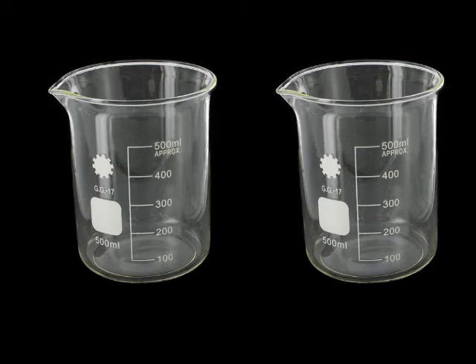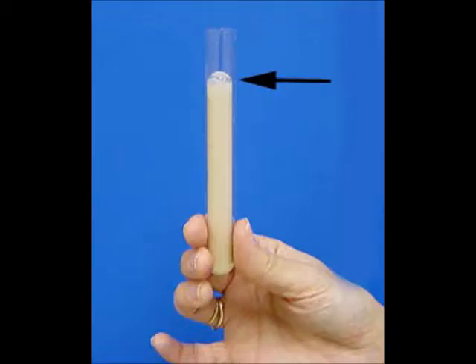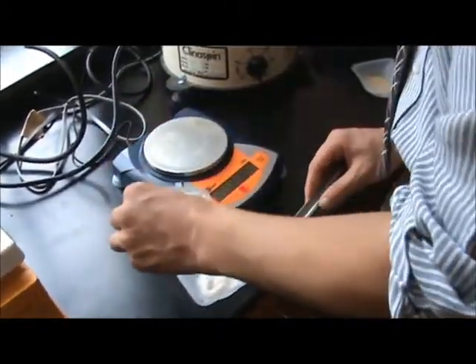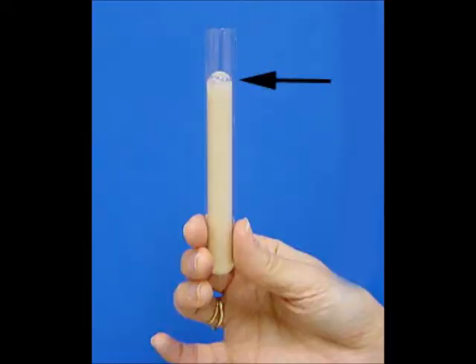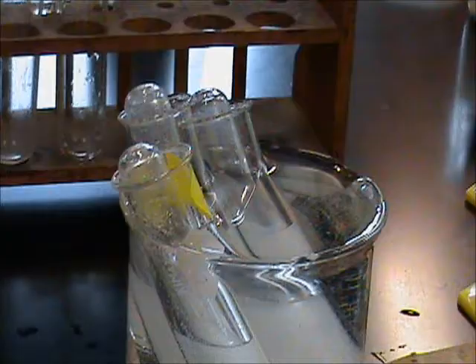Our experiment required a total of two 500 milliliter beakers and 6 test tubes, 3 large and 3 medium. As previously mentioned, the smaller test tubes would be used inside the larger ones. We filled the larger test tubes with yeast solution, and then weighed out and poured 2.5 grams of sugar into one test tube and 0.2 grams into another, leaving the third test tube with only yeast solution to serve as the control, because its absence of sugar would prevent cell respiration, and it would therefore fail to produce any carbon dioxide bubbles.